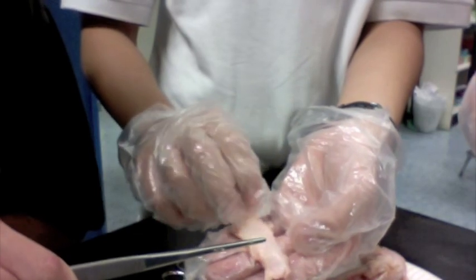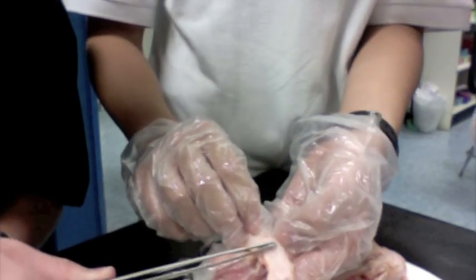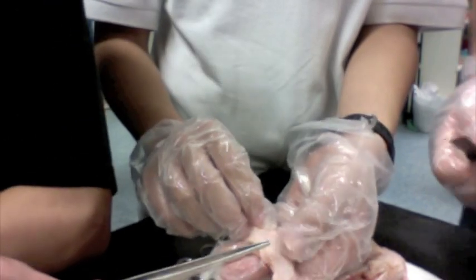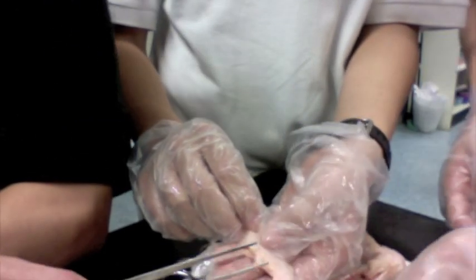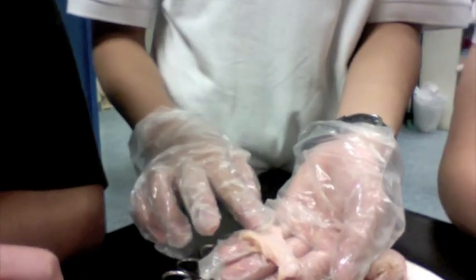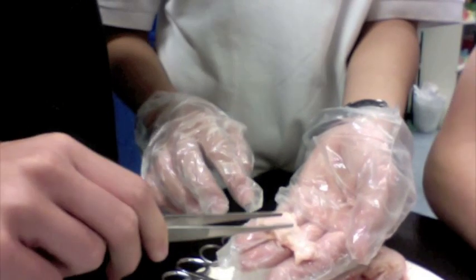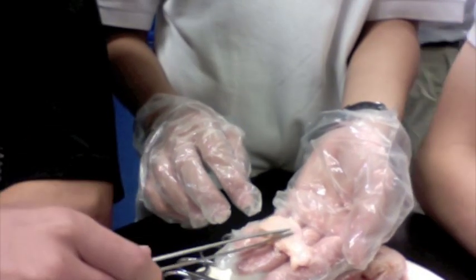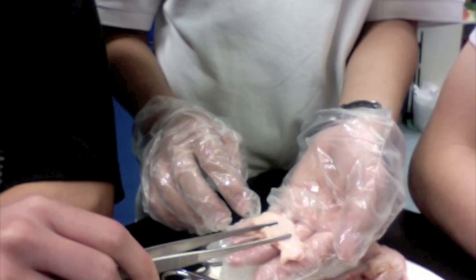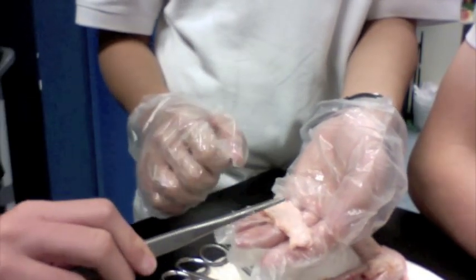Now, this is pretty thick because it's a necessary barrier, and being thick means that it keeps all the bad stuff out. But it doesn't have much moveability. It's also pretty elastic, because the chicken has to be able to do the chicken.